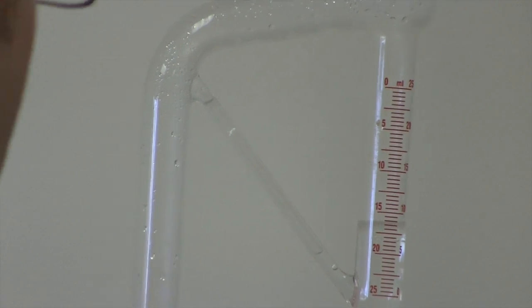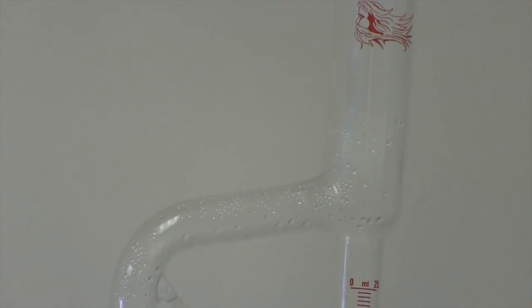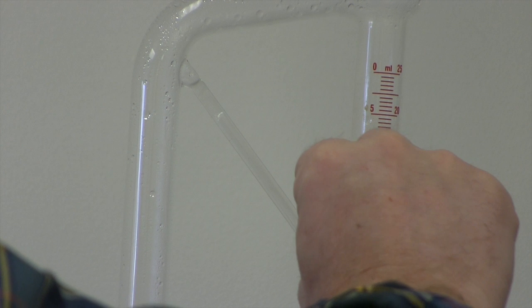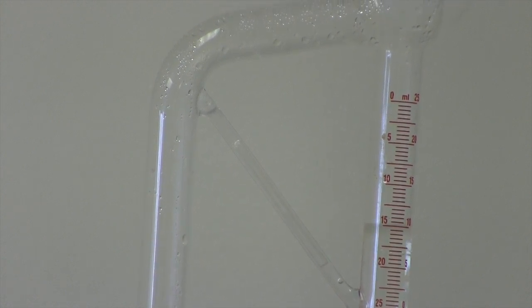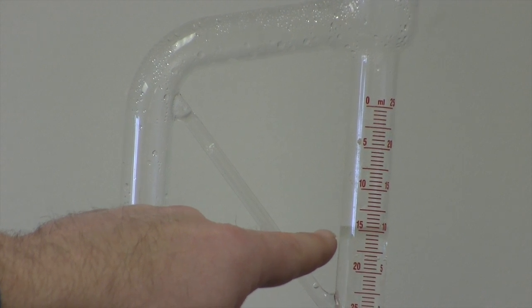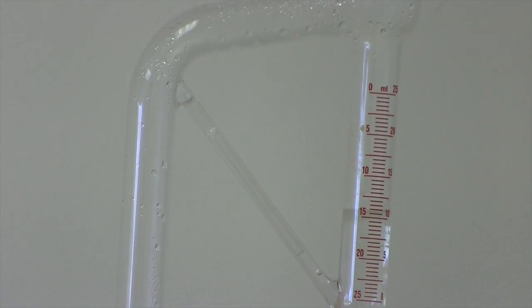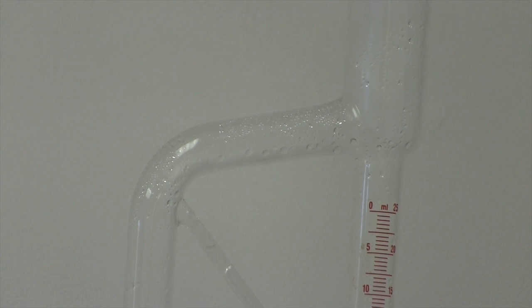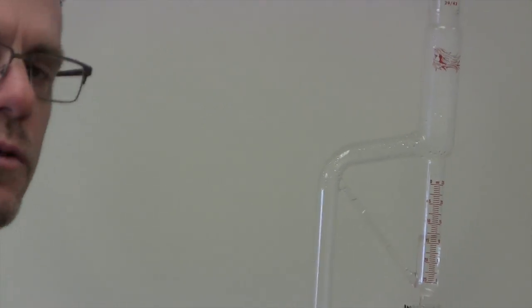I'll probably have to turn the heat down. And this color might change where it might be a slight yellowish color later during the distillation so you'll be able to see a clearer defining point between the oil layer and the water layer. There we go. Now it's probably a couple milliliters or so forming there on top. We'll let this go for a little while. Check back in when it's almost full and see how much we get.